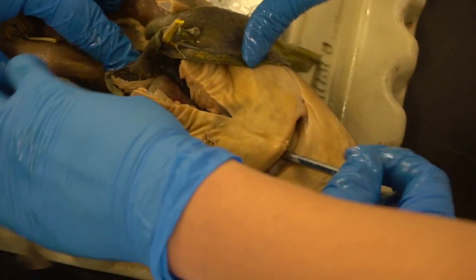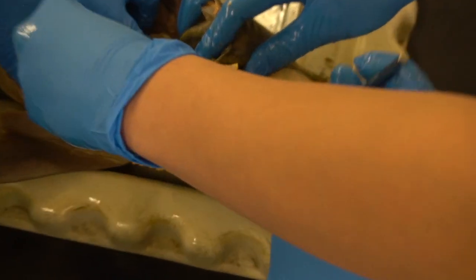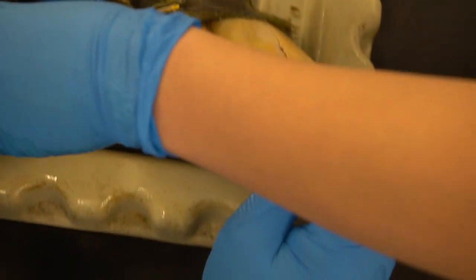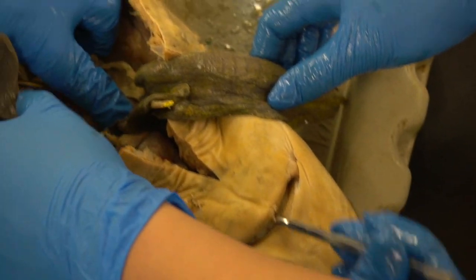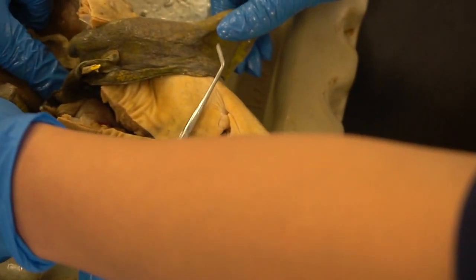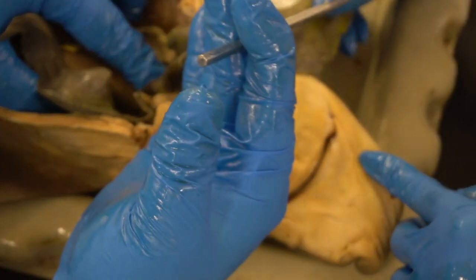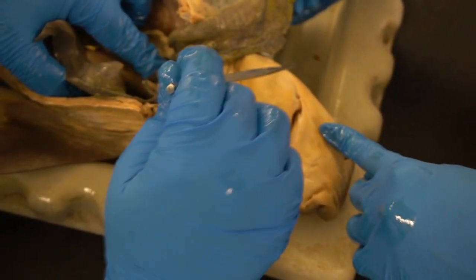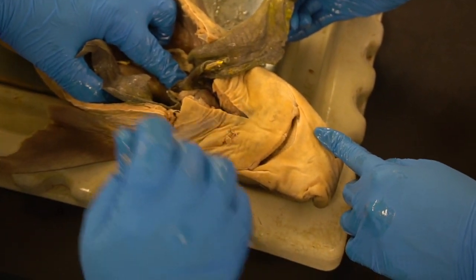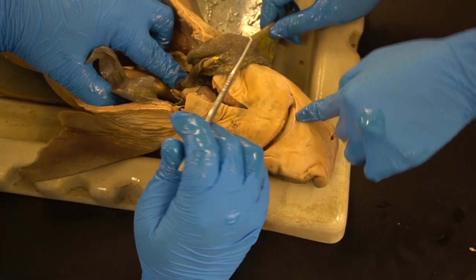All right. If I turned it left or right, where do I go? What chambers do I go? If I turn this and I go out the sides of the throat, that goes into the gill chambers. Okay, so similarly, we can make a section here, even if we sever off the head at that level. If we cut down and we reflect the head back, you will see that same thing that we saw with the perch. Okay, center down into the digestive system, left and right exits to the respiratory system.